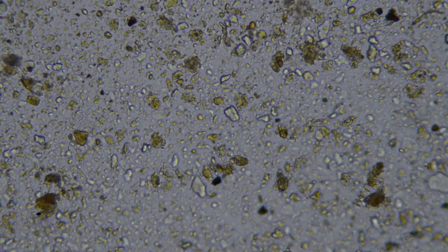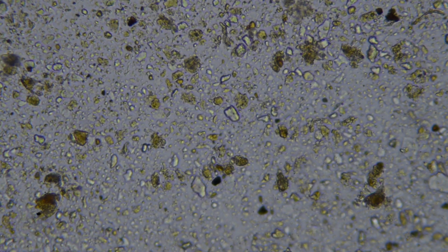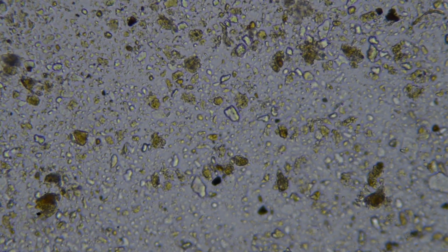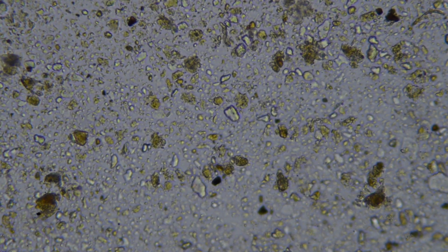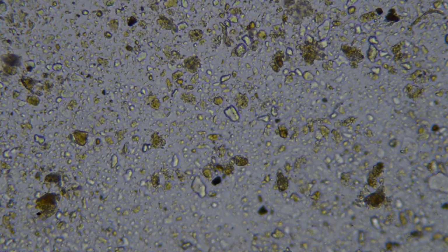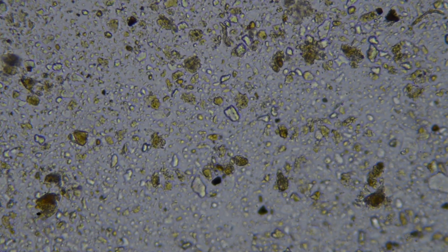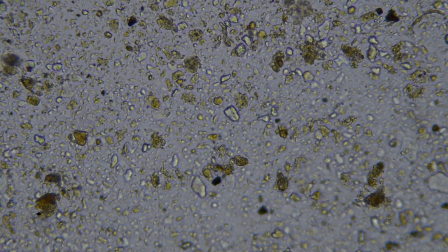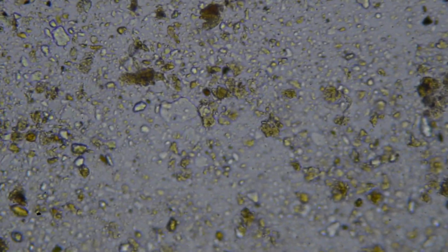So, what else we got going on in here? The other thing that we're looking for is all the predators. Here's another diatom just here, or a bit of a diatom. The other thing that we're looking for is the trophic levels of predators. So there's the protists, basically, nematodes, enchytraeids, earthworms actually would be regarded as predators.